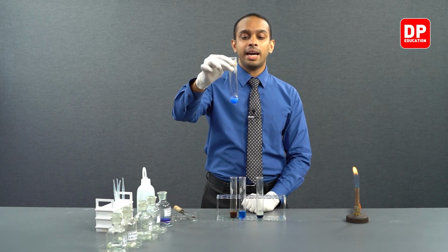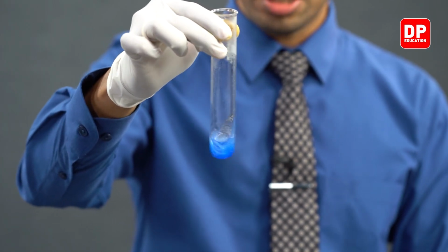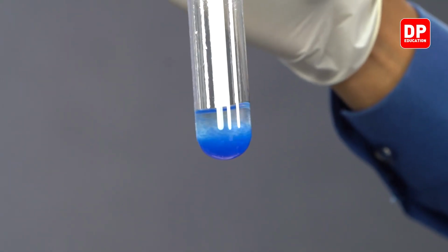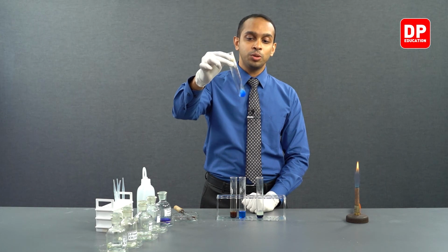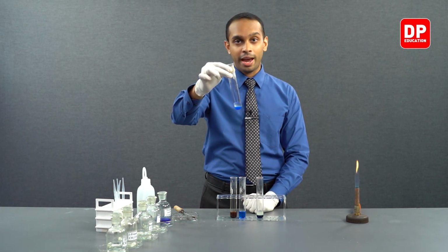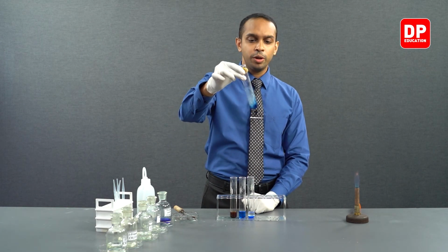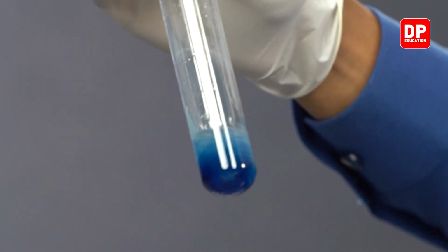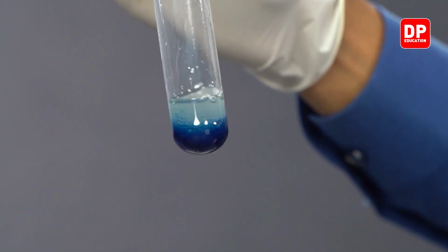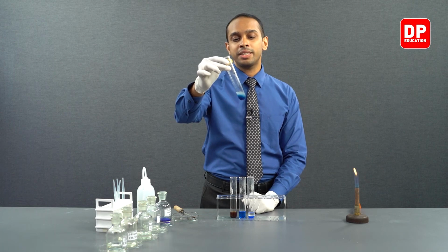Then we took benzaldehyde, our aromatic aldehyde. Even that did not react with Fehling's solution. The color of the Fehling's solution did not disappear due to Fehling's solution not reacting with aromatic aldehydes. Finally, we looked at aromatic ketones. Even that did not turn the color of the Fehling's solution into a brick red color, indicating it did not react with the aromatic ketones as well.